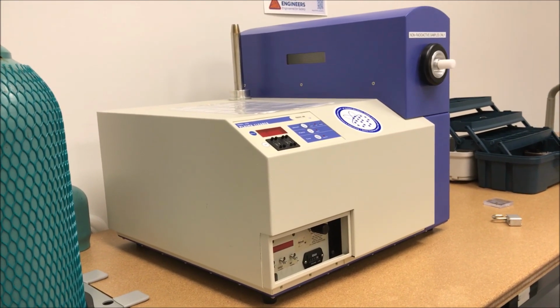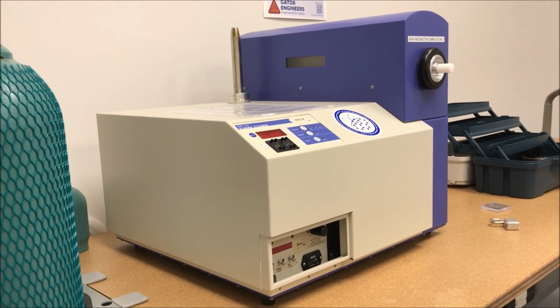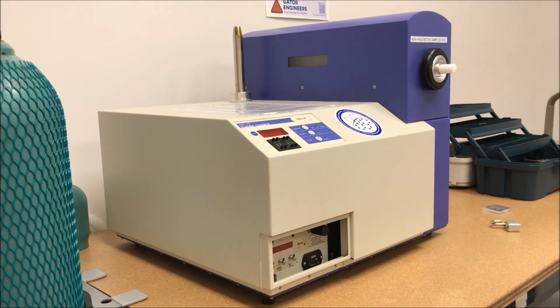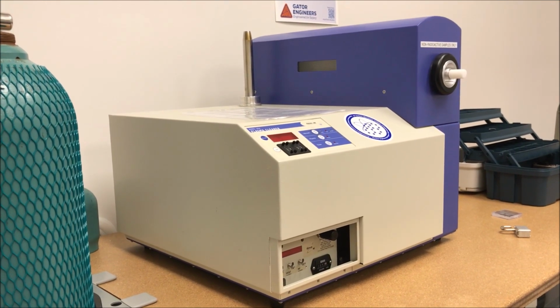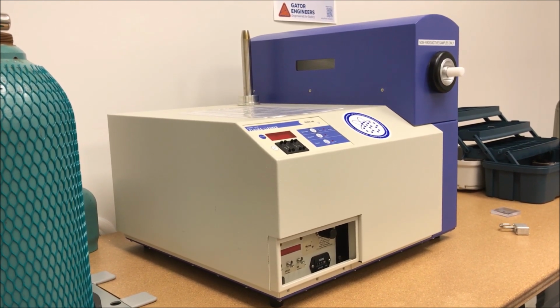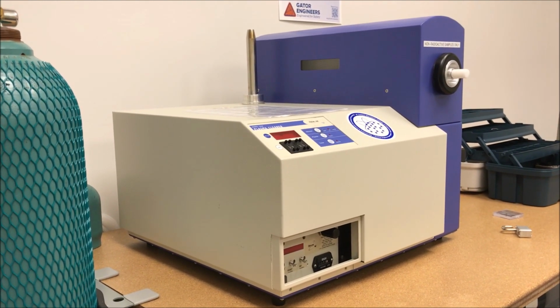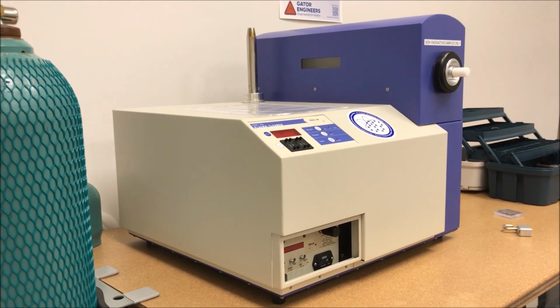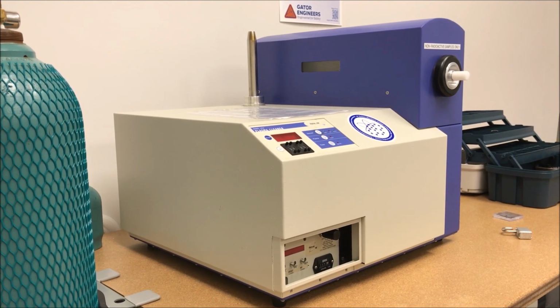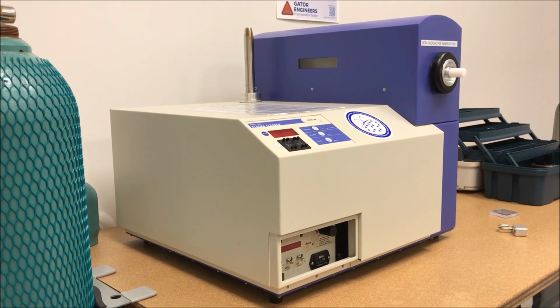Before that, though, another way to ensure that your sample stays as clean as possible is to always image it as soon as you can after you're finished making it. A lot of the specimens I make are FIB lamellas, and I always try to plan it so that I can perform the TEM on the lamella immediately after I'm done with the FIB, because that really is the cleanest that the sample will be, right after the FIB process is done. Even so, I do still plasma clean the samples before I put them in the TEM, but that basically ensures that the samples will be as clean as they possibly can be.